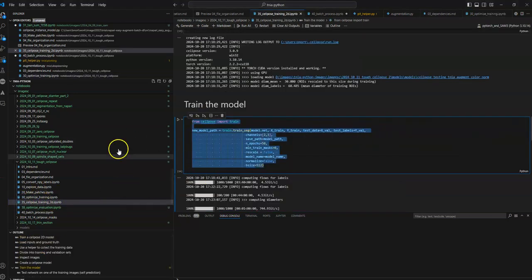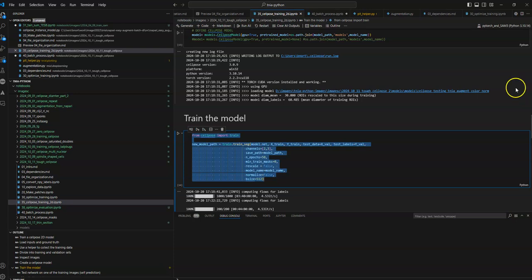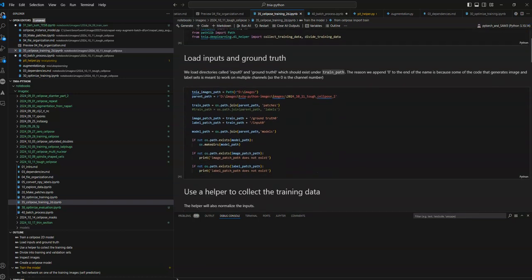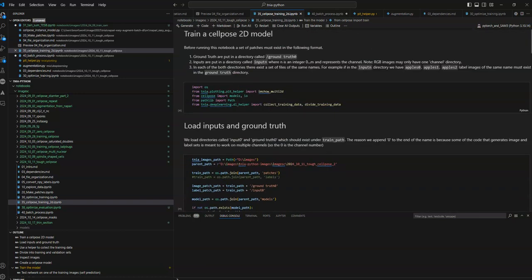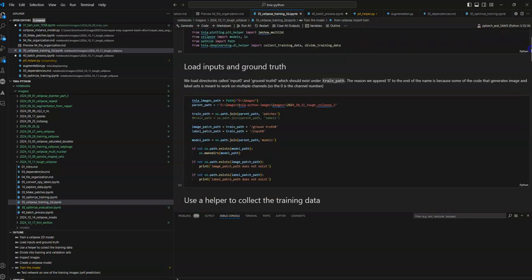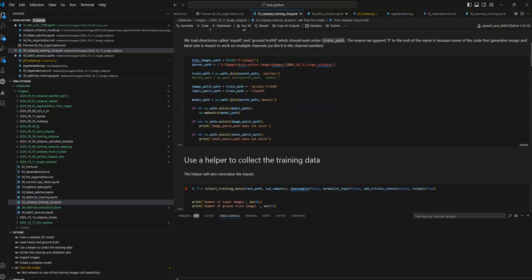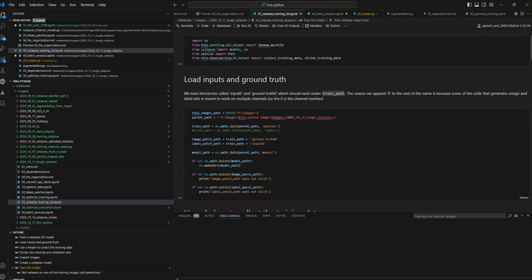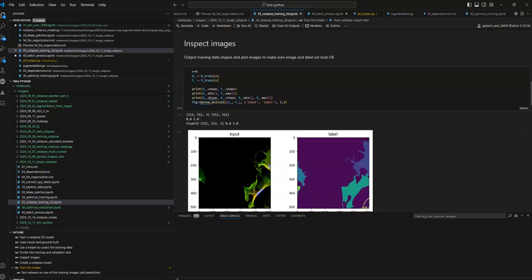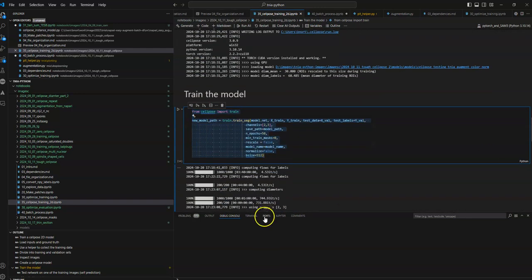So once you've figured out, okay, maybe I know the best training settings, then I have this training notebook, which is mostly just file manipulation code. It basically loads up all the patches. All my code expects things to be organized in a certain way. So if you like to organize things differently, hopefully this is more of an inspiration of some strategies to use, and you can make your own notebooks to get your images the way you like to organize them. But anyway, this is just grabbing all the images, then running the training with some of the settings that I found from Notebook 30.